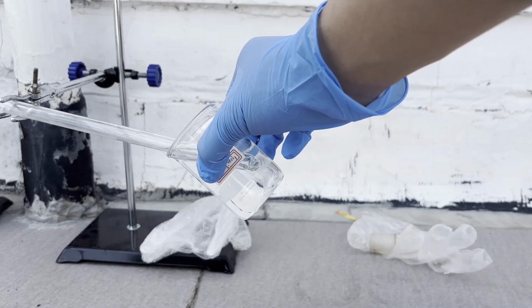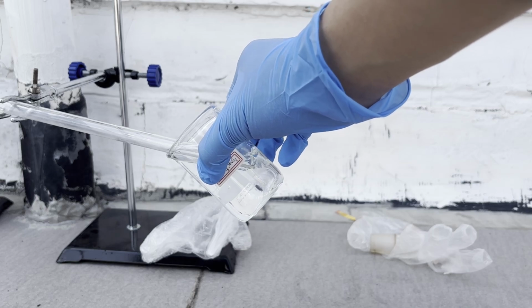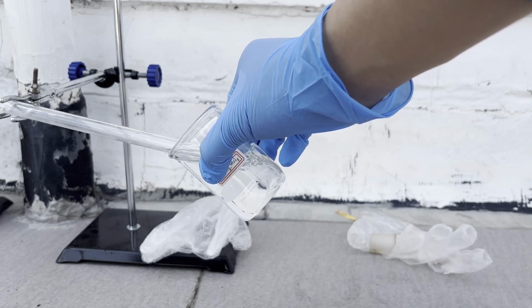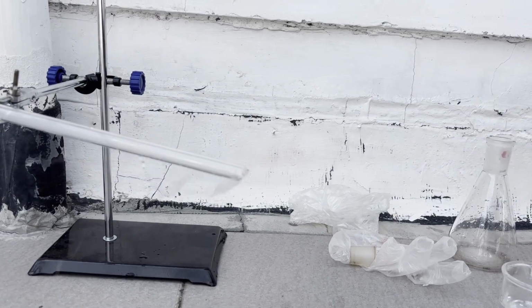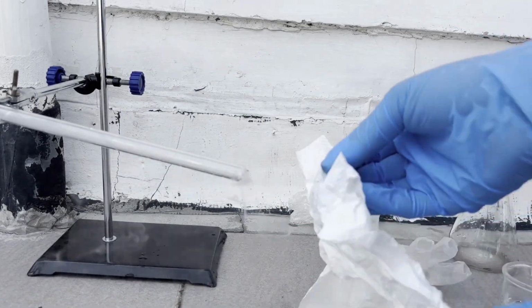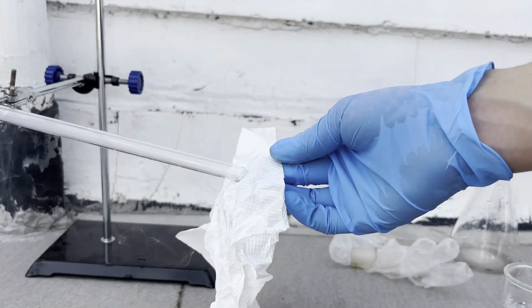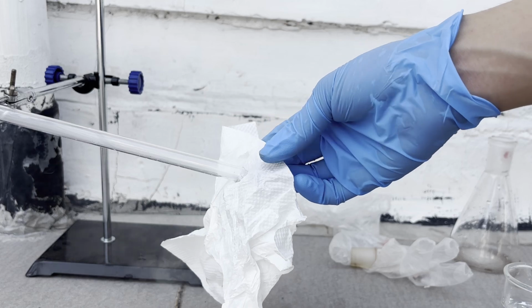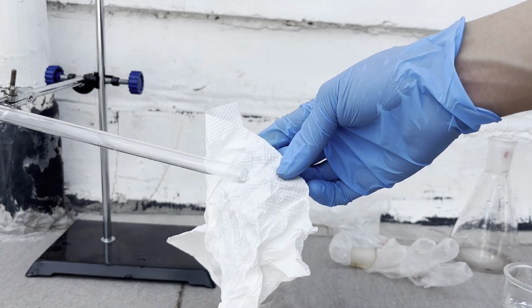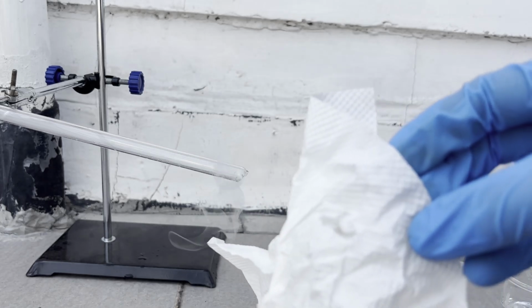I tried passing the gas through water, but the fumes simply carry on. There wasn't a super vigorous reaction that I expected, but the water also didn't get significantly acidic. I then added more sodium metabisulfite and sulfuric acid, and this time I tested the corrosive nature of this gas by passing it on a piece of tissue paper, but the paper only got slightly charred after a few seconds. This certainly doesn't fit the normal behavior of sulfur trioxide, as it was reported that sulfur trioxide instantly carbonizes any organic material within a second.